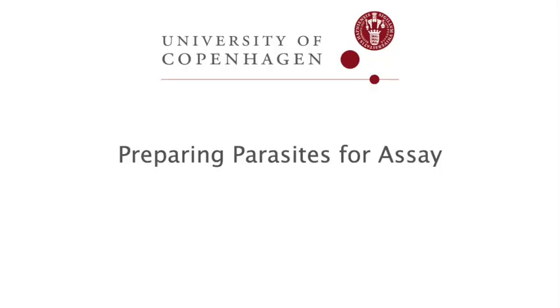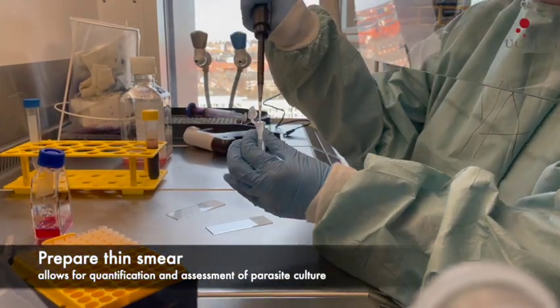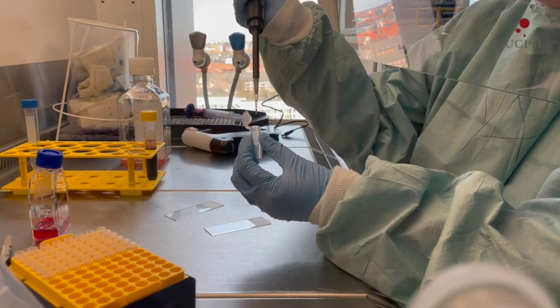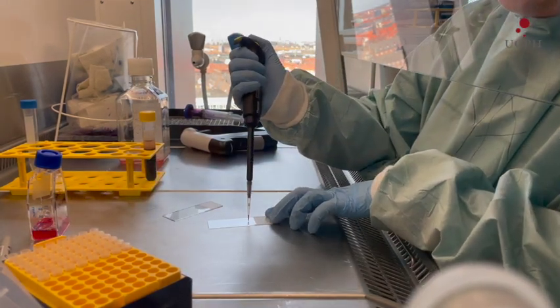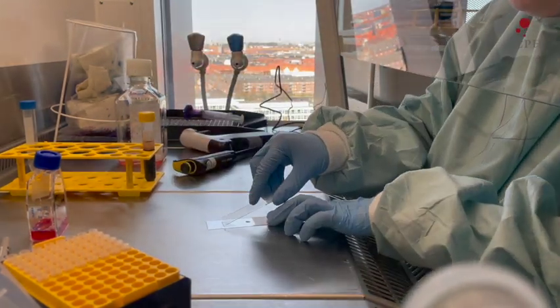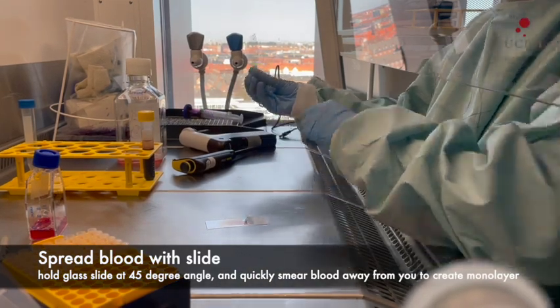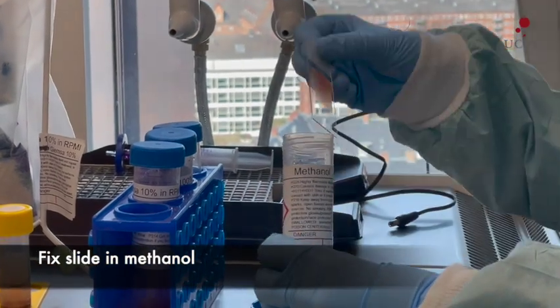Preparing a blood smear. To check on the health of the parasites and to count how many there are, prepare a thin smear. Add a few microliters of blood to a slide. Using another glass slide, hold it at a 45-degree angle and gently pull it toward you. Capillary action makes the blood flow along the edge of the slide, and when you push it along the glass surface, a monolayer of cells is formed. Fix the cells by dipping in methanol.